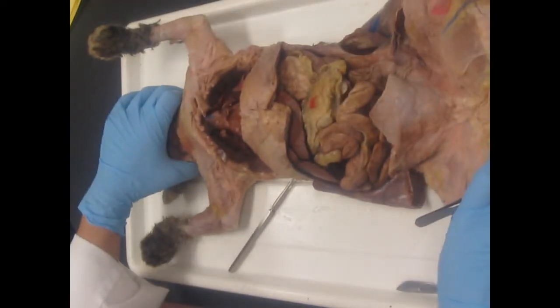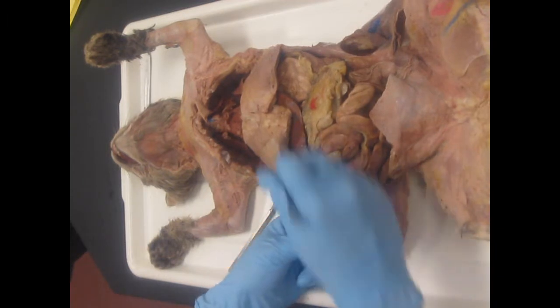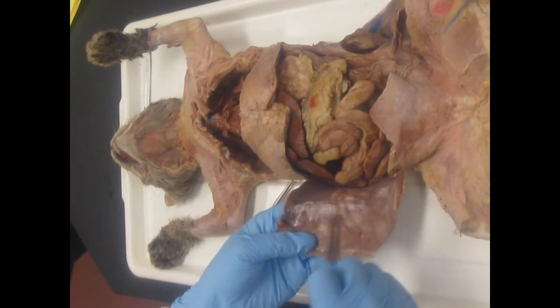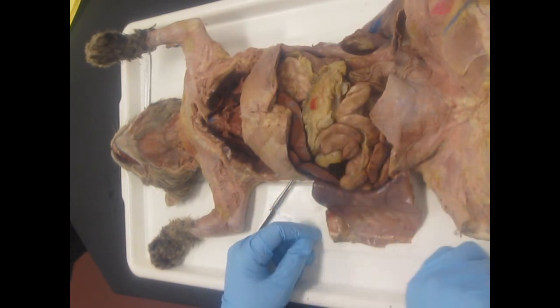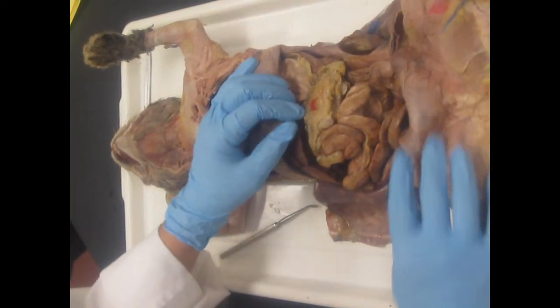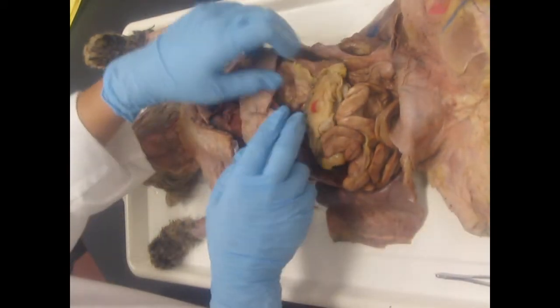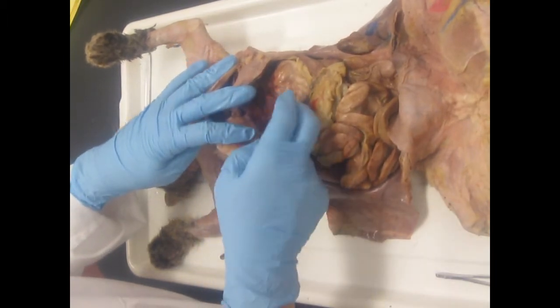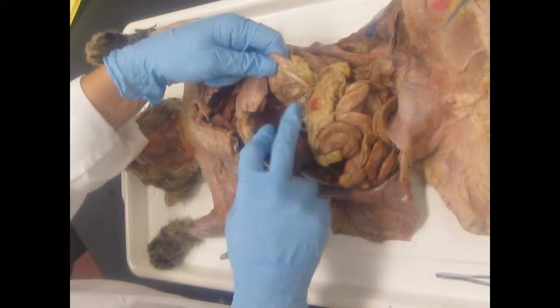Alright, then in the abdominal pelvic cavity, we have the peritoneal cavity. On the wall, parietal peritoneum. On the organs, visceral peritoneum. And then we have our few special membranes that are associated with the abdominal pelvic cavity, starting with the greater omentum. Now the greater omentum is stuck to the greater curvature of the stomach. Now this big brown thing is the liver, so you gently lift that back. And this giant pouch right here is the stomach.